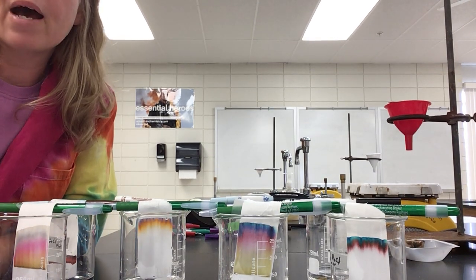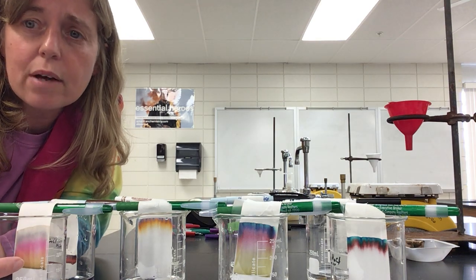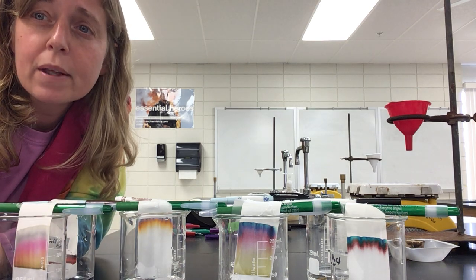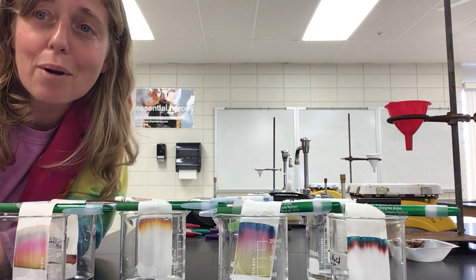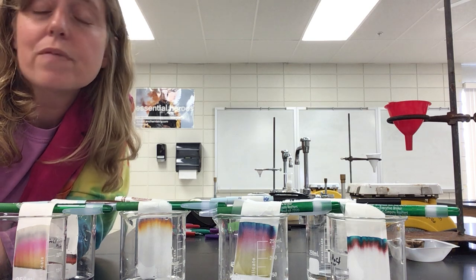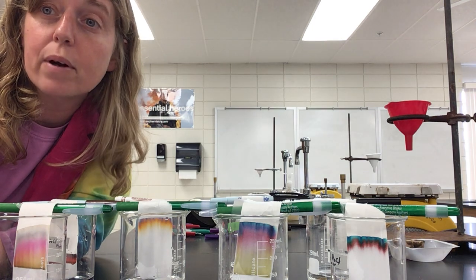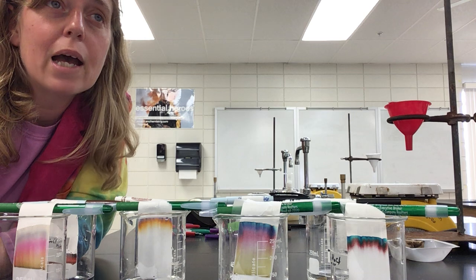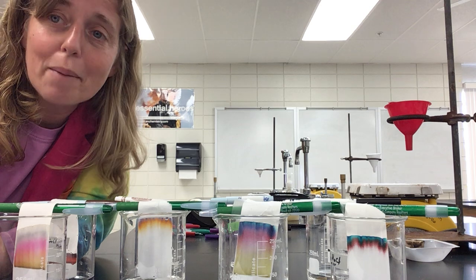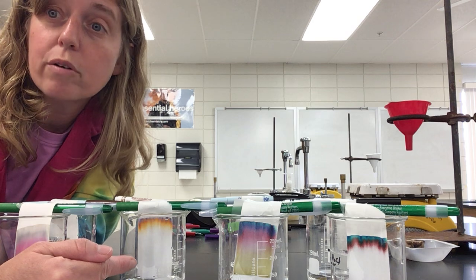And what do you notice about the Vis-a-Vis? Okay, it's a wet marker, and notice how big the band is of separation on the brown and the black compared to the Crayola. What do you know about that? Well, Crayola probably waters down its mixture a little more than the Vis-a-Vis. Probably because the Vis-a-Vis is a wet erase marker and you use it on an overhead projector. So those colors need to be a lot more vibrant. But if you go to the store and you try to buy Vis-a-Vis, they are actually way more expensive than Crayola. Probably because they're using more pigments in their colors than Crayola. So you can see these are kind of watered down, right?